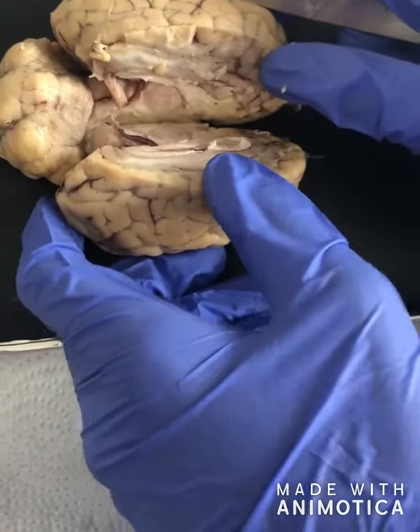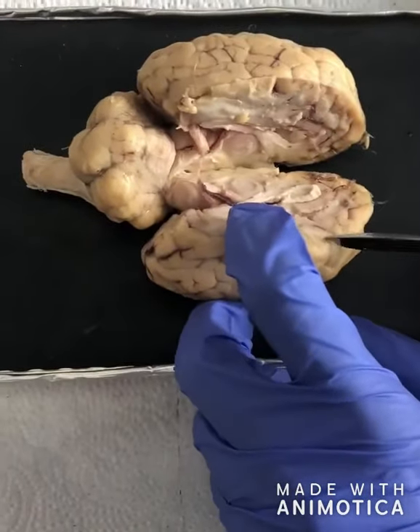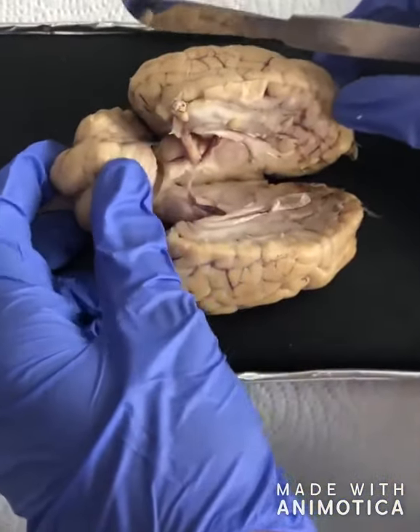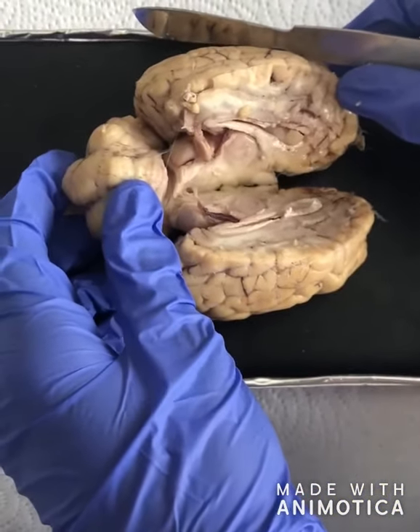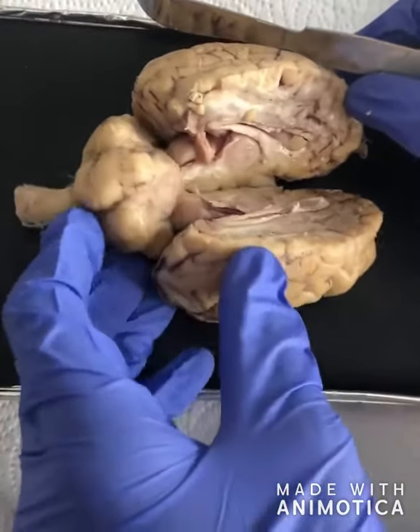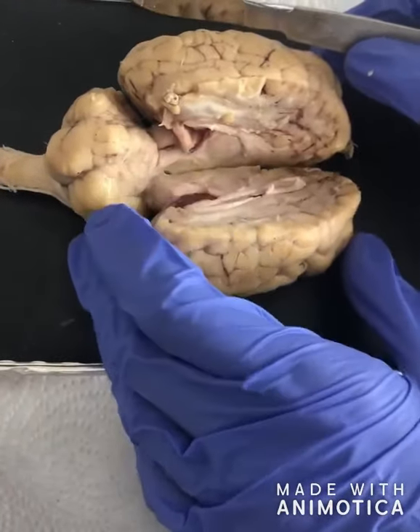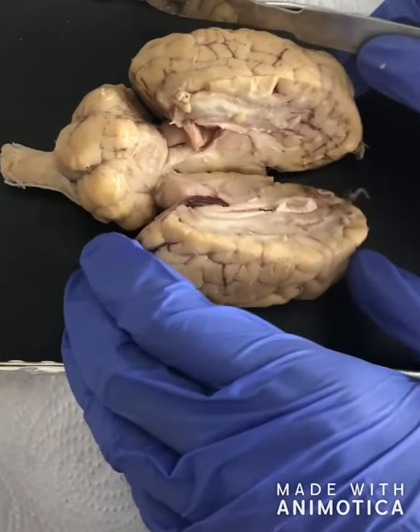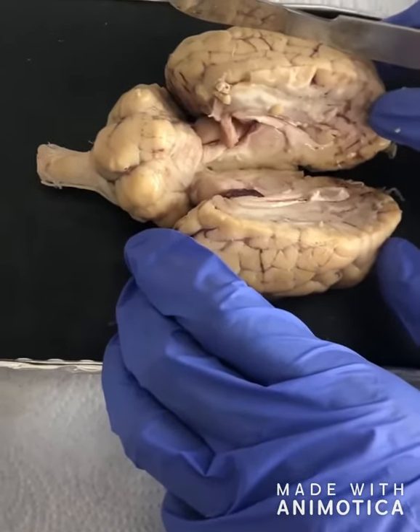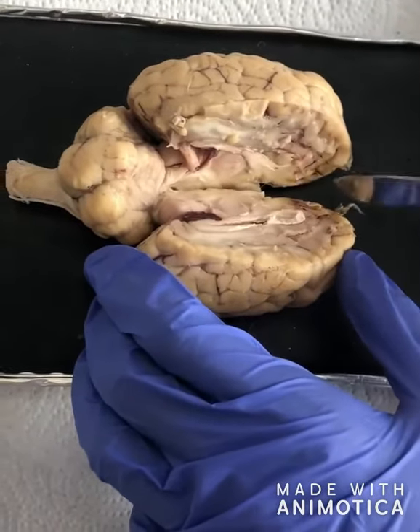Now, the thalamus is located just above the brainstem between the cerebral cortex and the midbrain. It relays motor and sensory signals to the cortex, and the hypothalamus is located on the undersurface of the brain, just below the thalamus and above the pituitary gland. An important function of the hypothalamus is to link the nervous system to the endocrine system via the pituitary gland. It controls body temperature, hunger, important aspects of parenting and attachment behaviors, thirst, fatigue, sleep, and circadian rhythms.